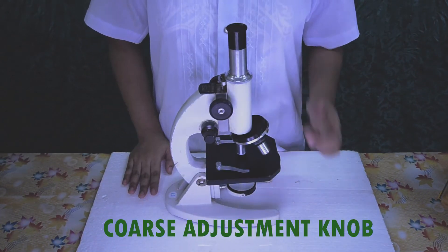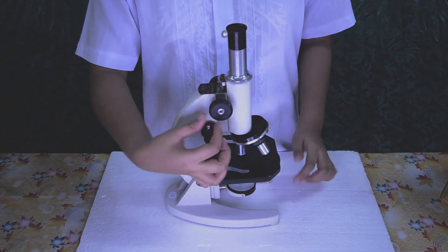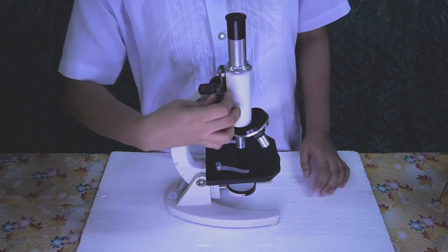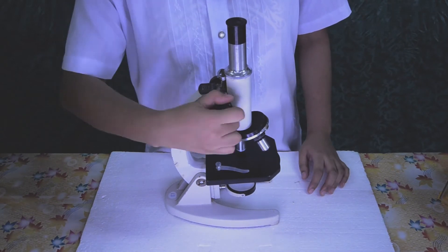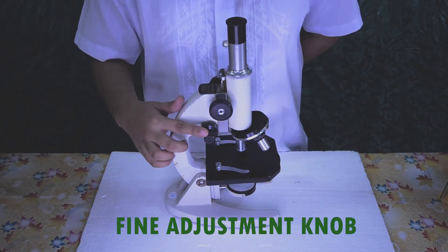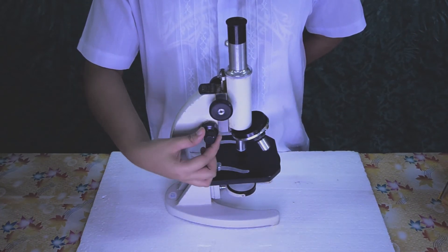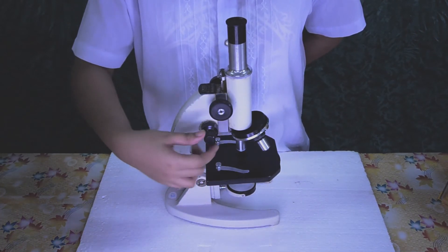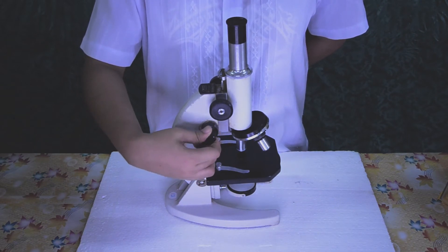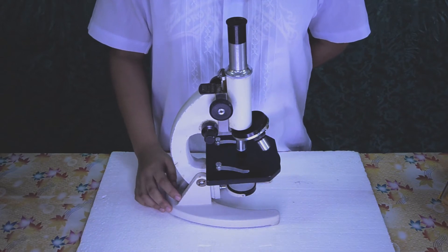Coarse adjustment knob. It is a large-sized knob used to move the body tube up and down for bringing the object into focus. Fine adjustment knob. It is a small-sized knob used for fine and sharp focusing of the object. Exact focusing is done by this knob.